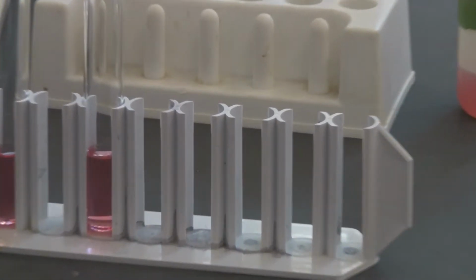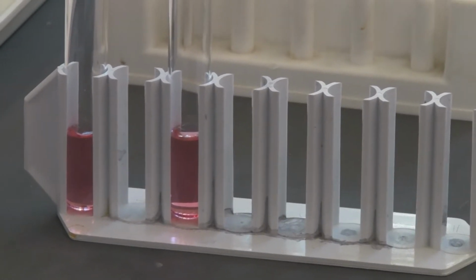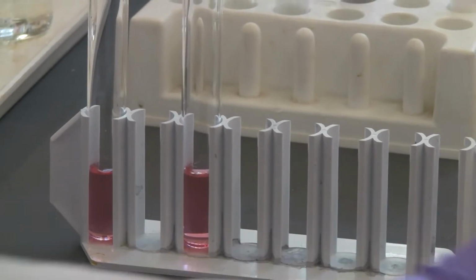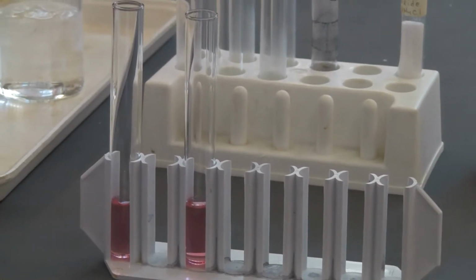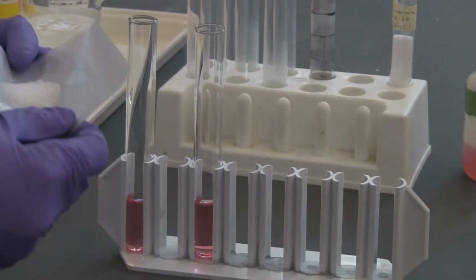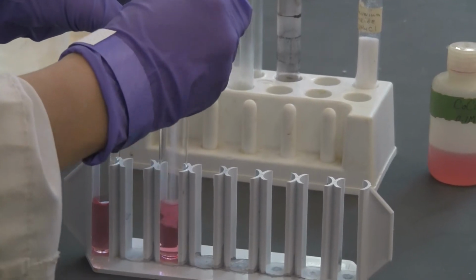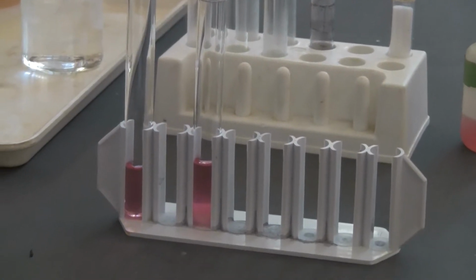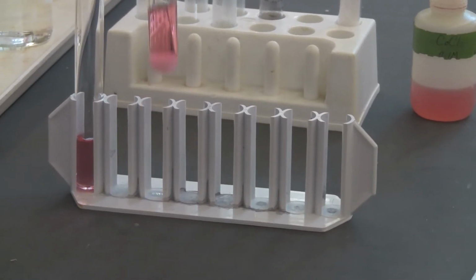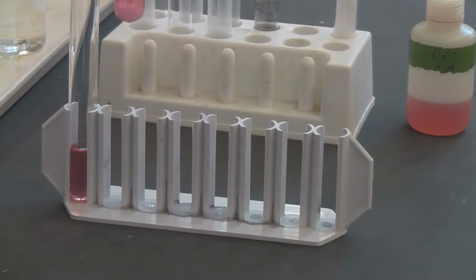And then in one of the test tubes, I'm going to add 1.5 grams of the solid ammonium chloride, which is here. It's already weighed. That's about 1.5 grams. So in our test tube 2 here, I'm going to add it. Now I'm going to shake it, try to make it dissolve and saturate the whole solution.